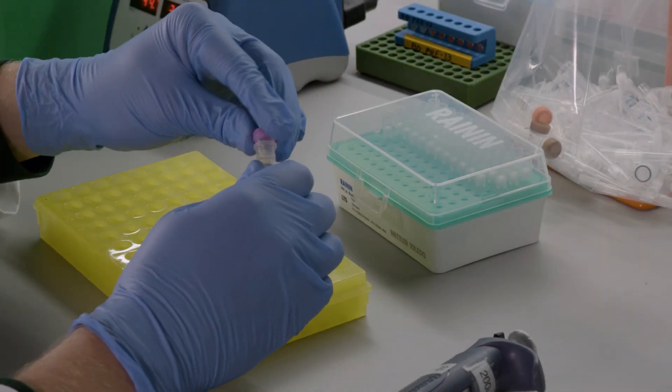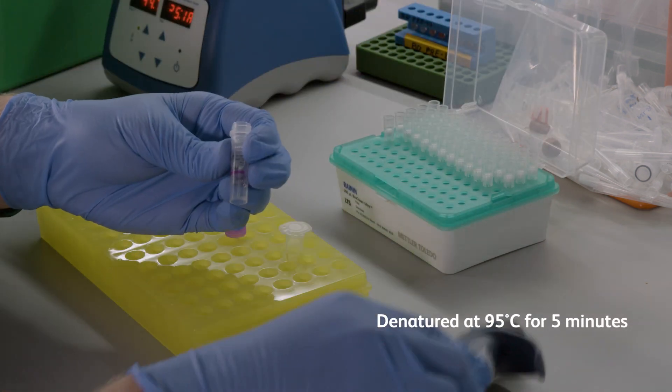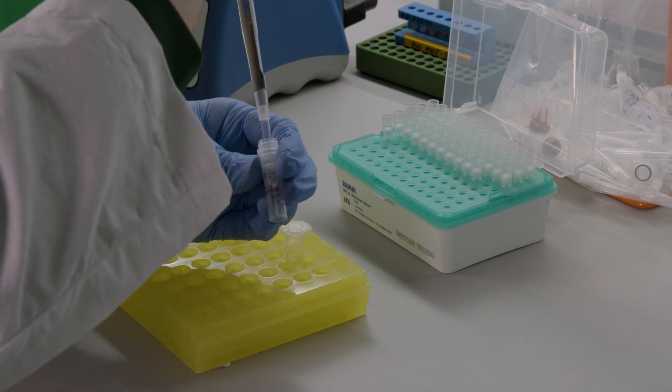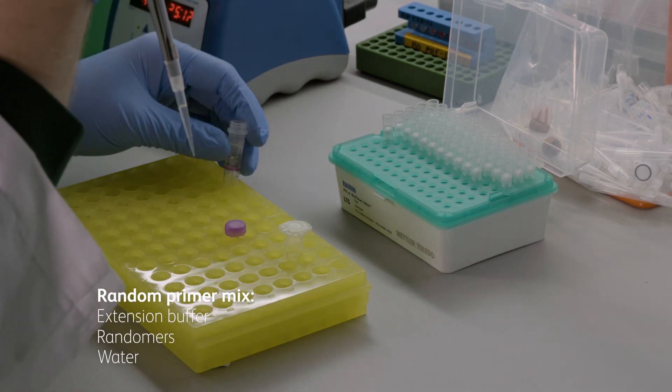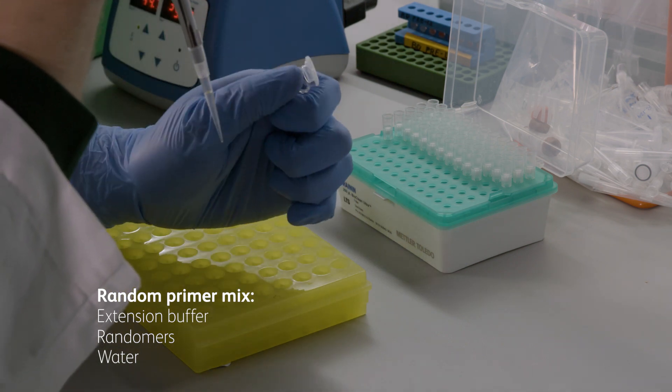The volume of beads we decided to proceed with are then denatured at 95 degrees Celsius for 5 minutes. While the beads are incubating, prepare the random primer mix by combining the extension buffer, randomers, and water by pipette mixing.